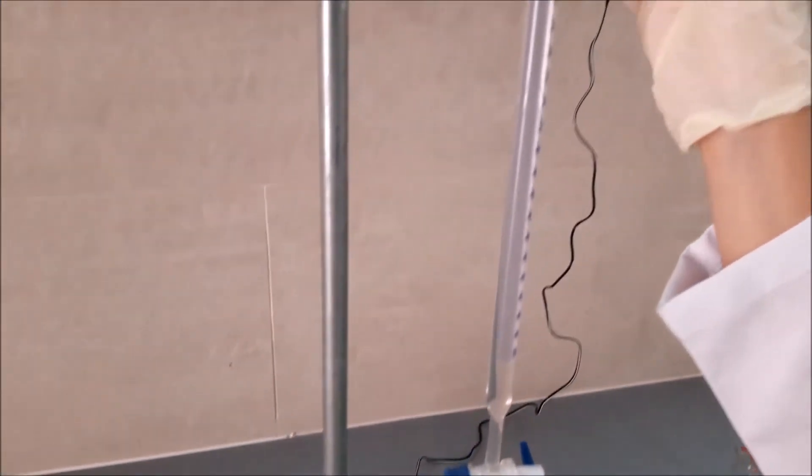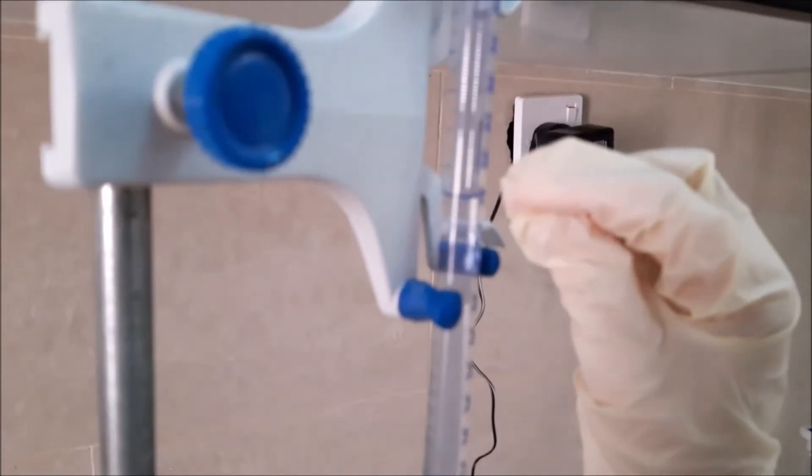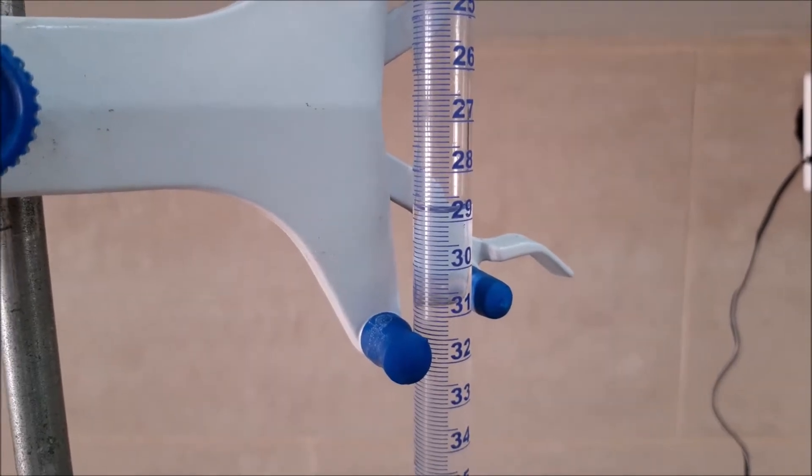So our final reading is 28.8. The final reading is 28.8.